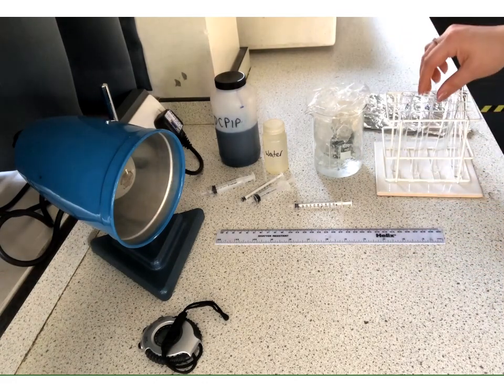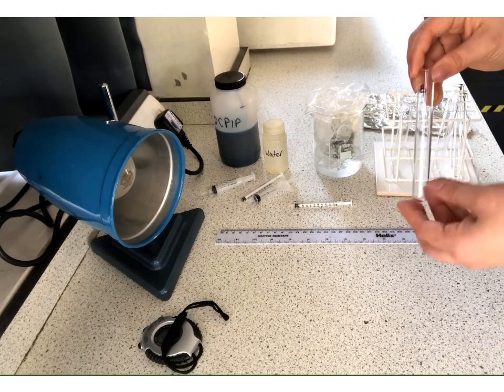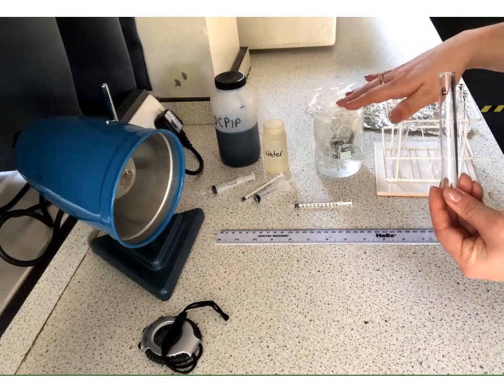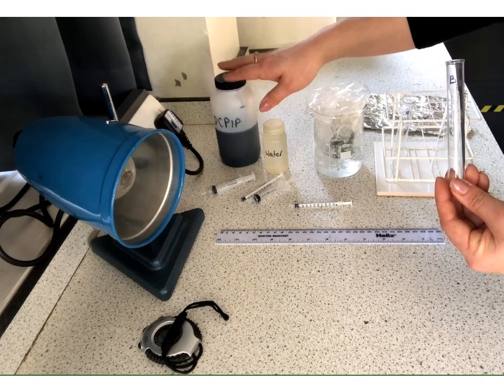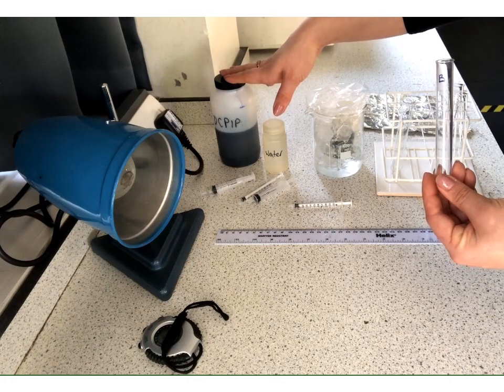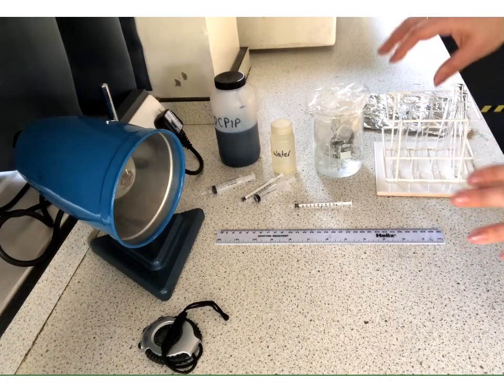In the second tube, tube B, we're going to place 5 centimetres cubed of the DCPIP. We're going to have 2 centimetres cubed of water and no chloroplasts. This is going to prove to us that it is the chloroplasts that are causing the reduction of the DCPIP, so causing the colour change. That it's not just the DCPIP spontaneously changing colour, or it's not the effect of the water. Okay, so again, we've got these two controls. So I'll set those up now.